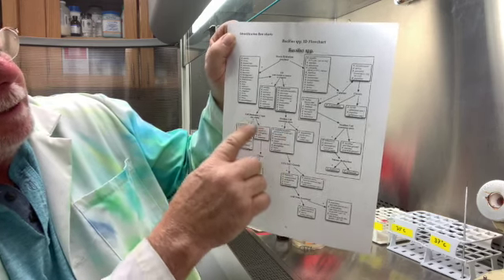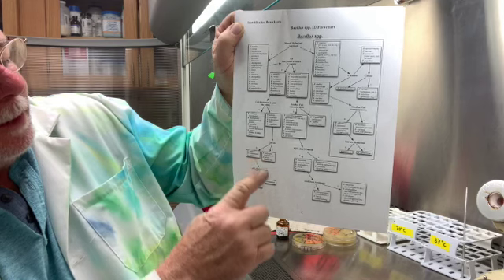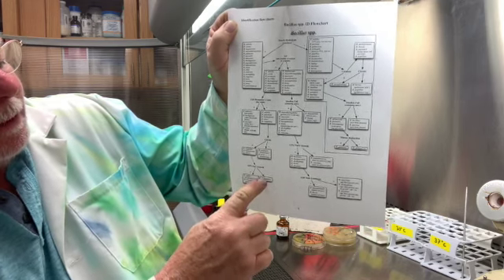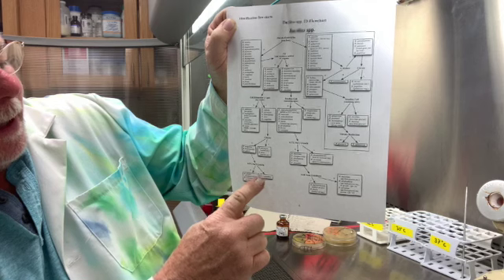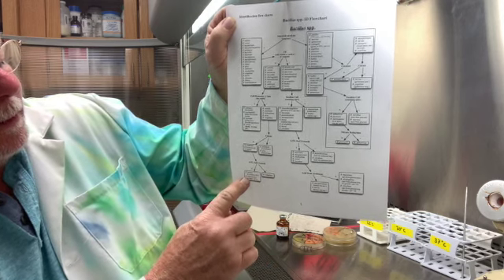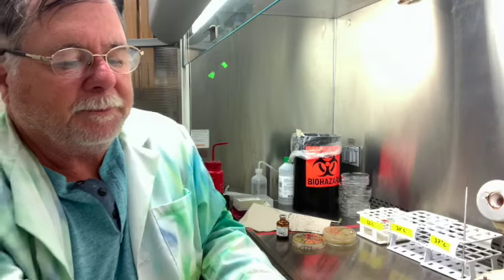Then we can look at some of these other characteristics. Here's a citrate test, here's a sodium chloride test, and then we can narrow it down to basically a couple. In this case, if it went to B coagulans, then it would just be that. Two of them would be Bacillus subtilis and B licheniformis. And so then you basically get it down to one bacteria.